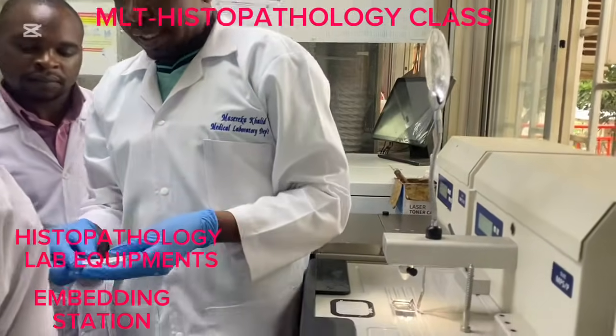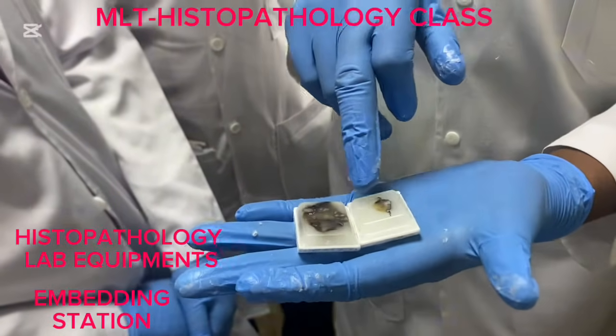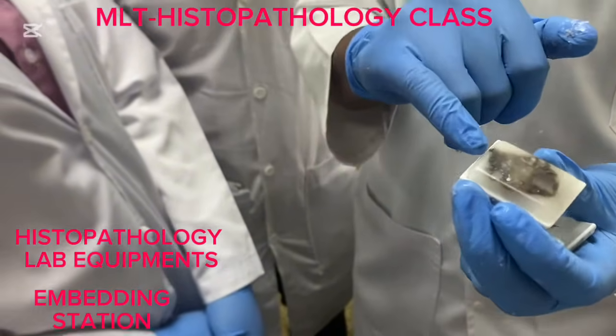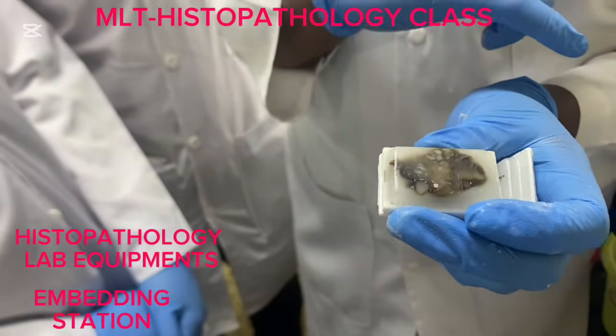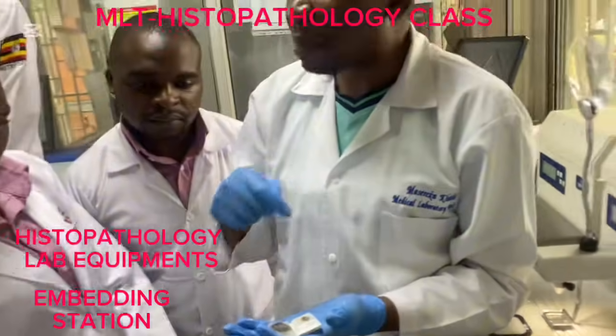So let's look at these two blocks. This first one, the tissue is in the middle very well. However, the second block, there is an extension. Are we seeing? From the surface. Are we there? So either the tissue was bigger than the mold.